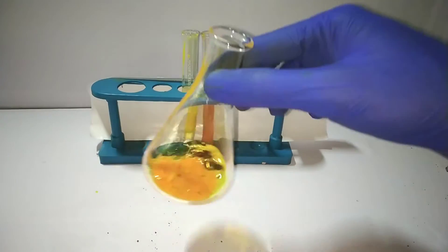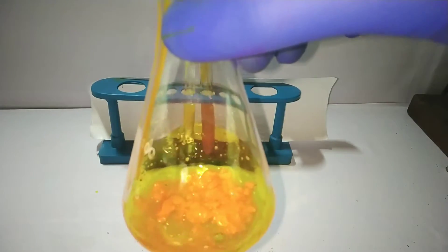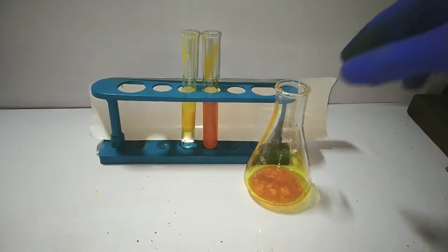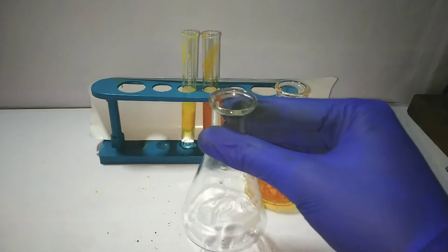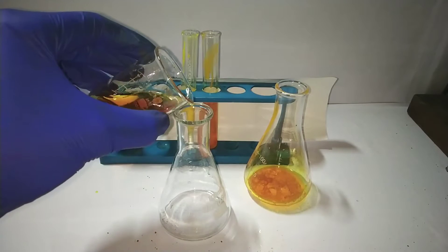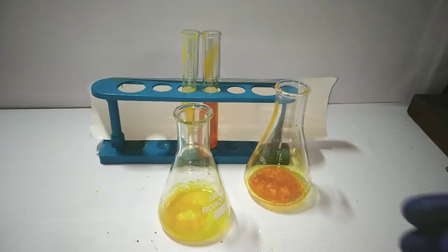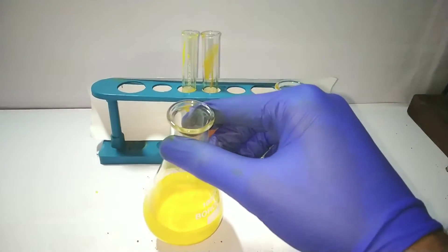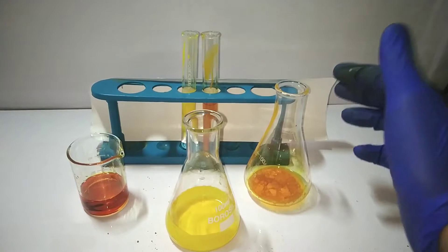Meanwhile, I will give you some tips on the reaction that you should be careful about. Some aliphatic ketones may not give a precipitate with 2,4-dinitrophenylhydrazine. In such case, reverse addition—that is addition of the solution of the carbonyl compound to the 2,4-DNP reagent—gives better results. It is actually advisable to do a blank test, which I did not do in this case. It is purely the 2,4-DNP reagent alone without the carbonyl compound. Some amines like aniline may give a precipitate of the salt of amine with acid used in the preparation of 2,4-DNP reagent. However, this precipitate is soluble in water. Another thing is sometimes 2,4-dinitrophenylhydrazine itself can precipitate out as an orange solid, which is soluble in dilute sulfuric acid, whereas 2,4-DNP hydrazone is not soluble in acid.